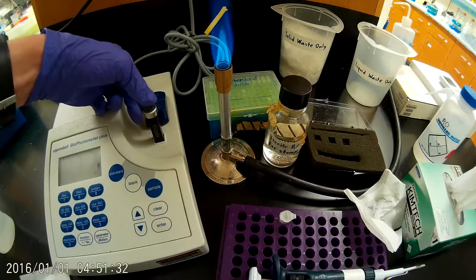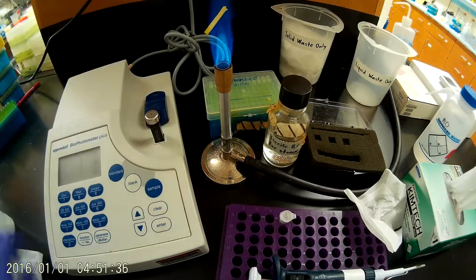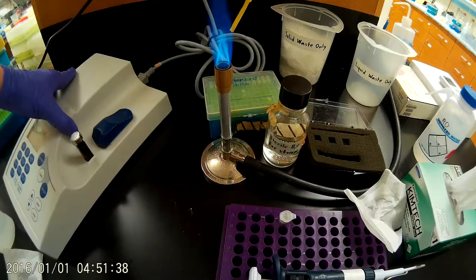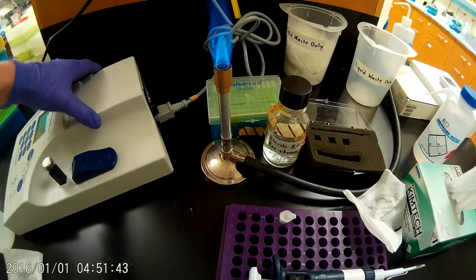So when you put that in the machine, you want to push it all the way down. Otherwise, no light will be able to pass through the aluminum body. We're going to turn on the biophotometer. There's a switch in the back here. So we're going to press that.